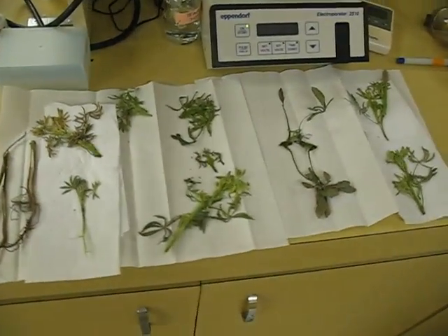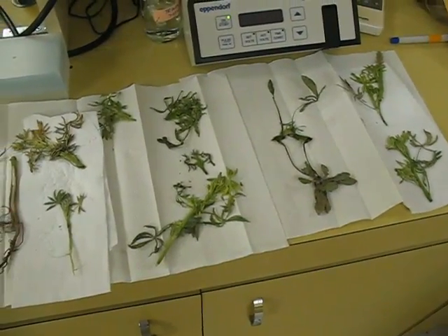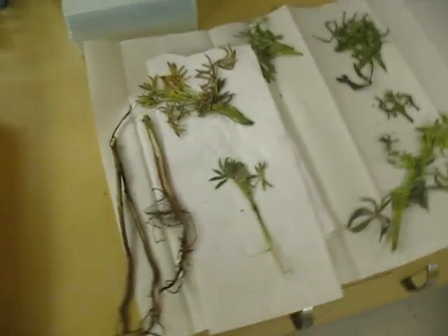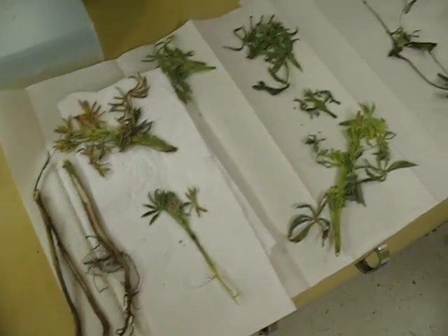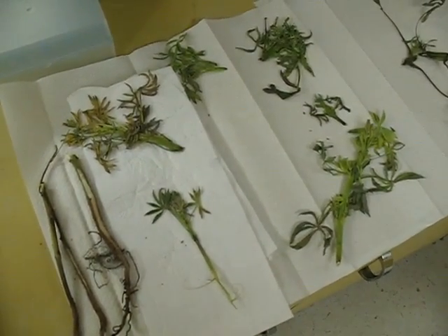What Nigel was saying was that we should take samples from five plants to give you a good sampling of the population. The roots down here — we're not going to do anything with them; they were just looked at with regard to possible fungal infections.